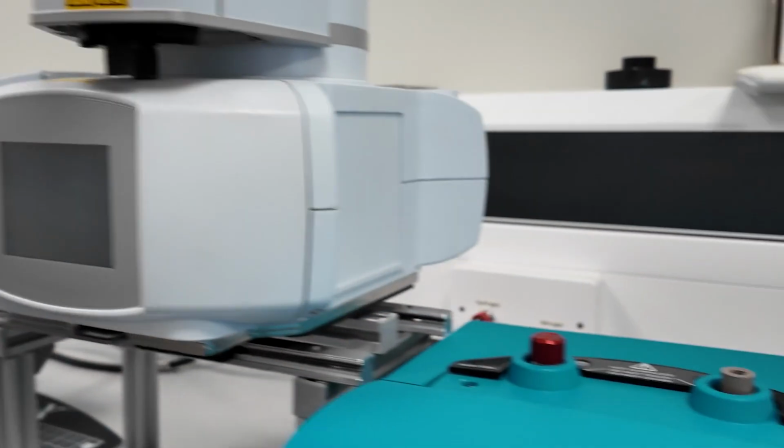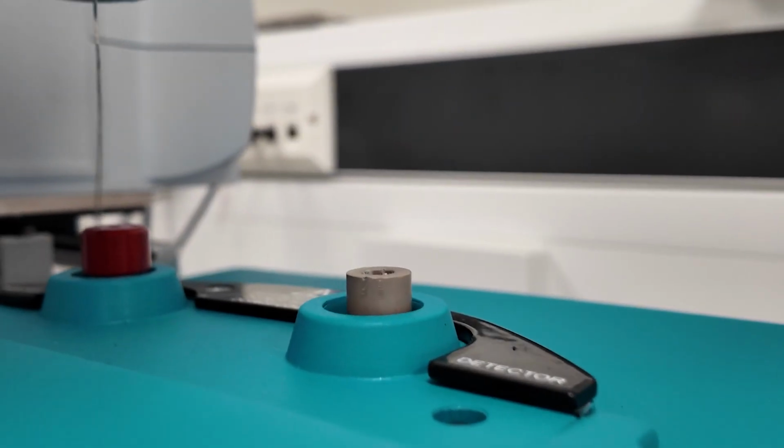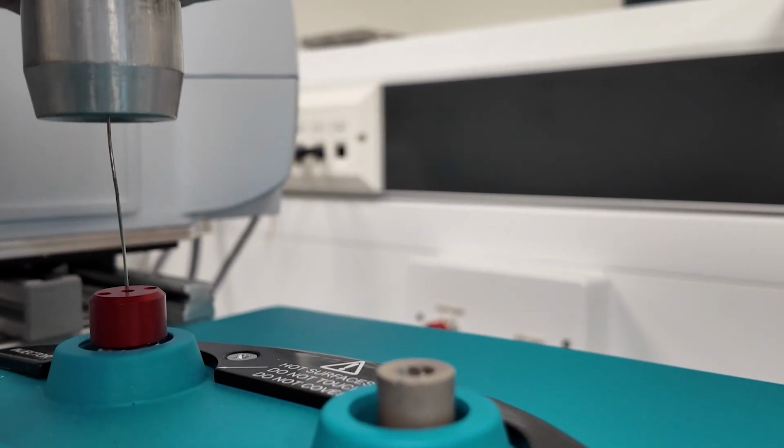Now it's time for the real sample. The vial goes into the headspace sampler where it's heated and gently agitated. This releases the volatile compounds, including the diacetyl and the acetylpropionyl, into the headspace above the liquid. A portion of that headspace is then injected into the GC. Now, if you don't have an autosampler, you can also inject manually using a headspace syringe. You're going to draw about 1 mL of the vapor and inject it directly into the injection inlet.